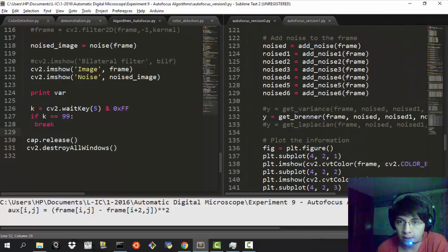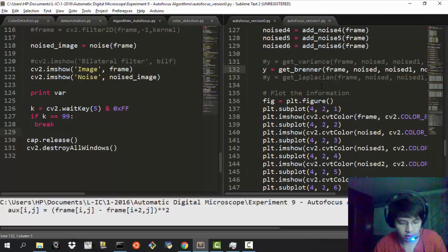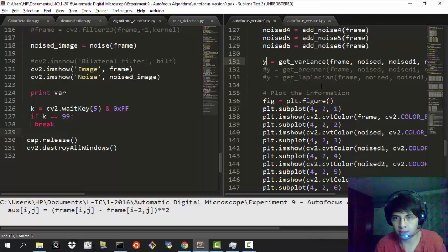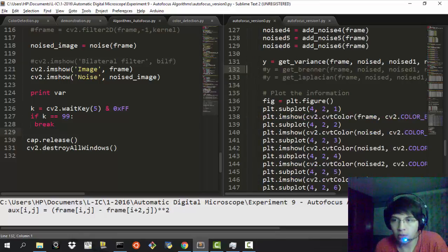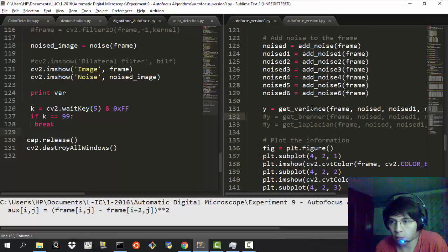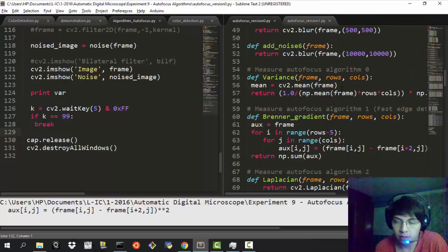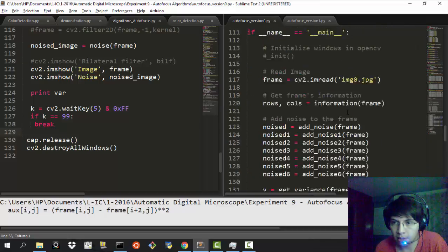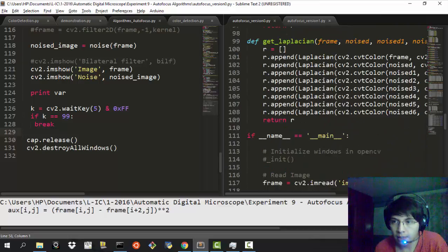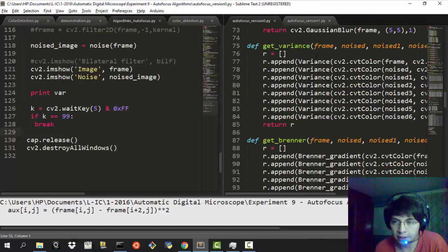Okay, so these are the images that we obtained from those functions, and then I'm going to use these three functions that I have made to make things easier. So we're going to start with the variance, as I said. We're going to send the frame and all the noised images that we have acquired here, and we're going to measure the variance. This is the function that measures the variance in the image. As you can see, I'm using NumPy to make things even better: here's the power of 2 and the frame minus the mean of the frame. And of course, the function that I have shown you is called from another one.